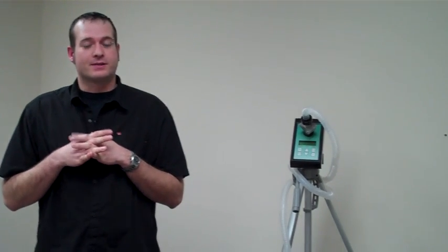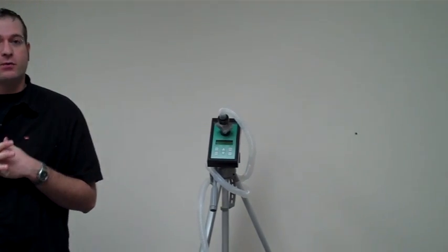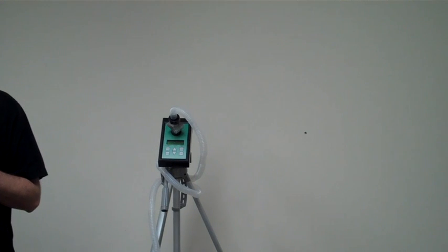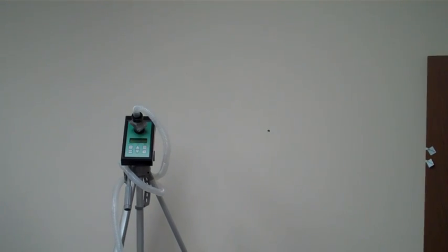Hi, I'm Brandon and I'm here with my associate Craig. Today we're going to collect a wall cavity sample. A wall cavity sample is where we pull air from within a wall cavity. It is then analyzed to determine if there is a likelihood of a source of mold within that cavity.